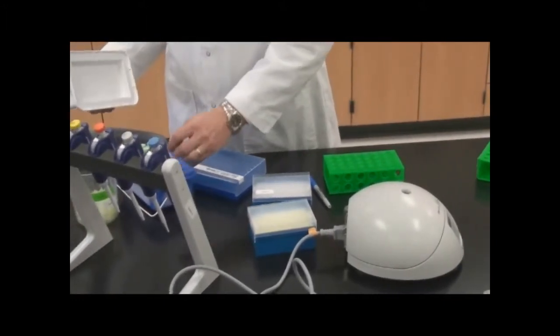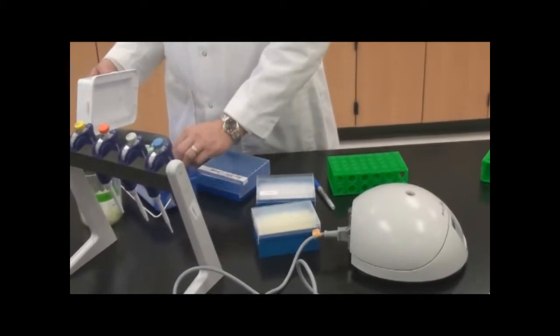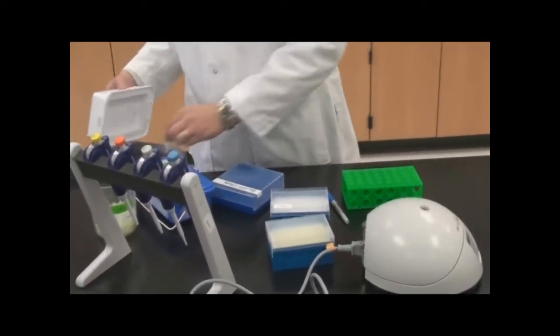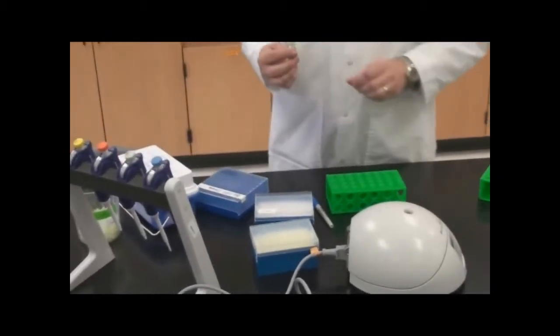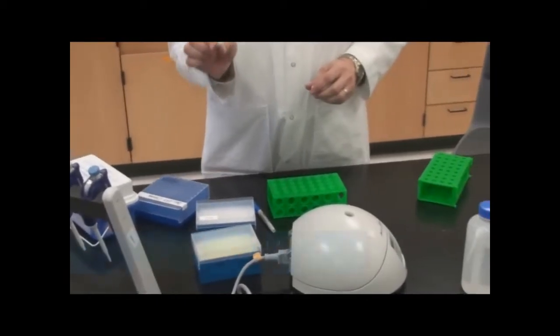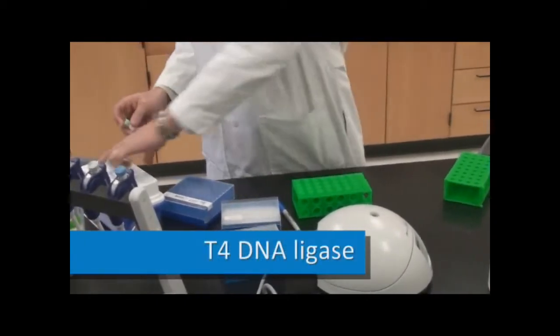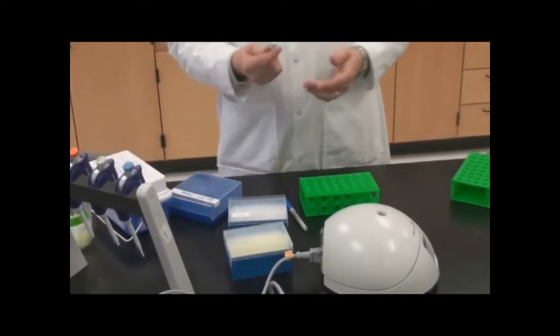First of all, we need to go back to our cloning box here. For the ligase reaction, you have T4 DNA ligase, so that's going to be our enzyme that we're going to add. We'll put that back in to keep it cold.